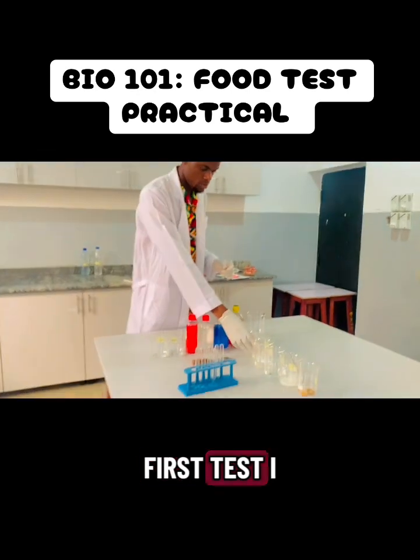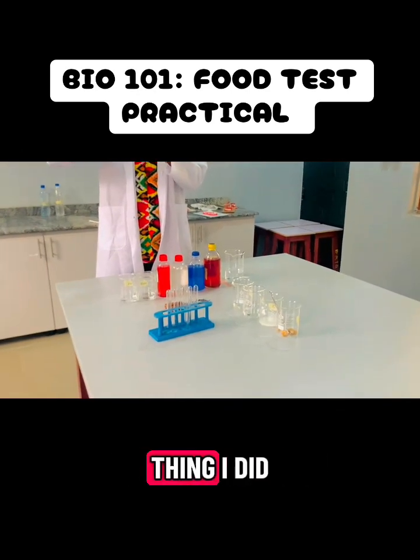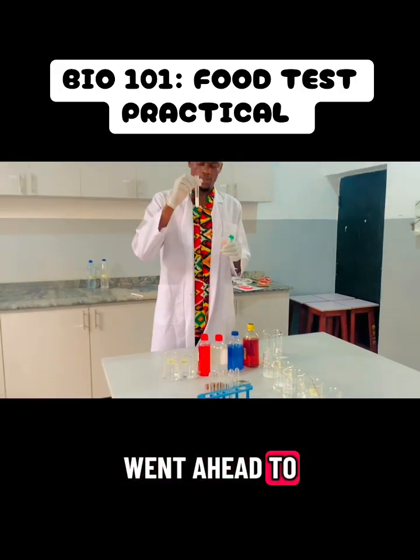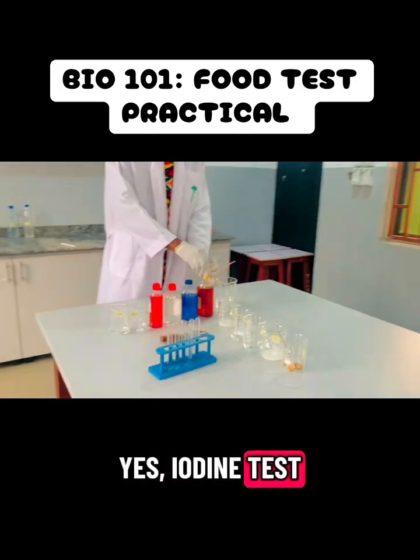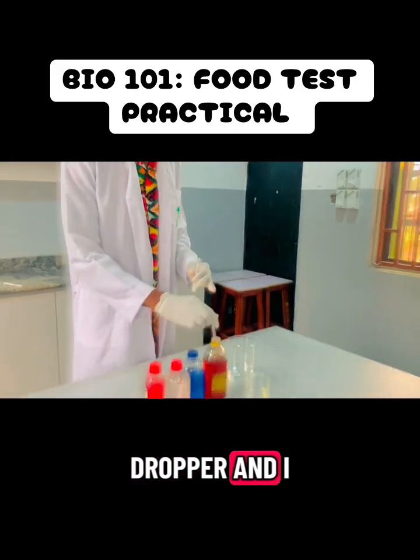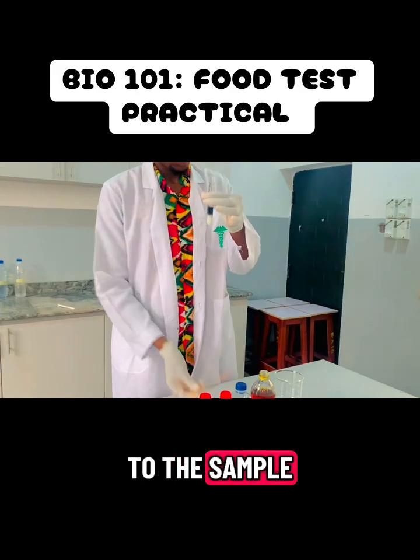Okay, so the first test I carried out here is the starch test. The first thing I did was to add my starch sample, after which I went ahead to add my iodine. The iodine test is the test for starch. I picked a reasonable amount with my dropper and added a few drops to the sample in the test tube.